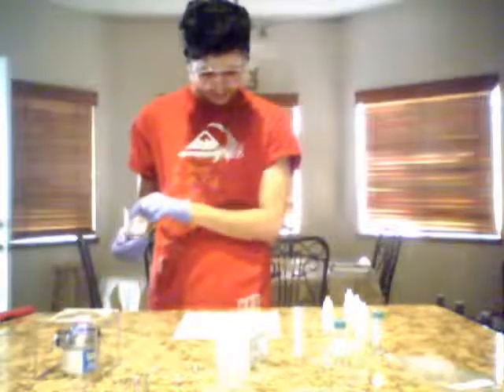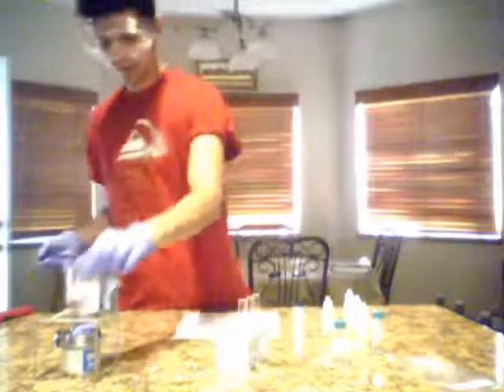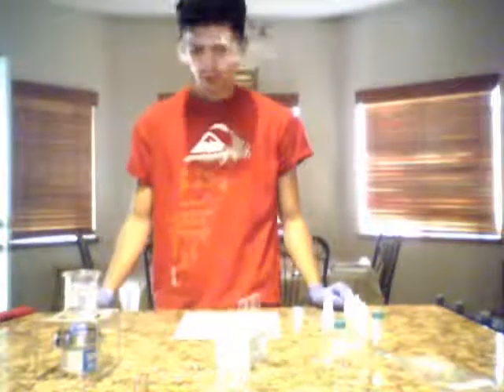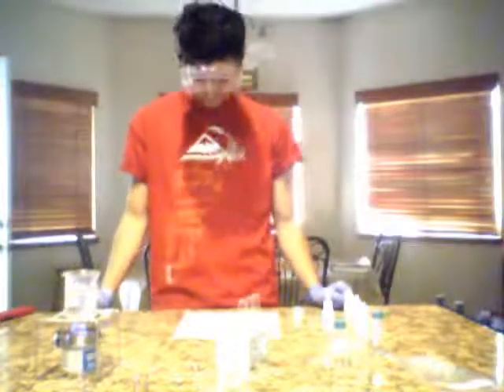So it says, okay, place it on. And now we're just going to wait for the water to begin to boil.